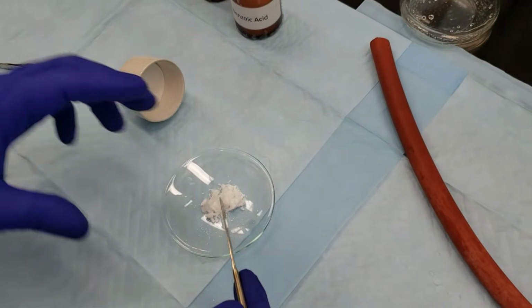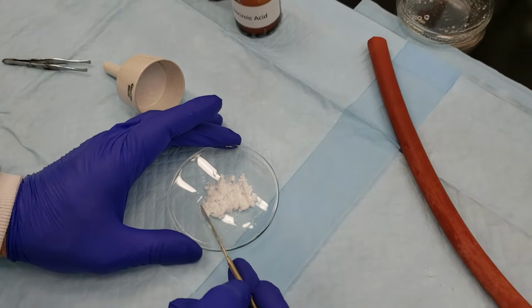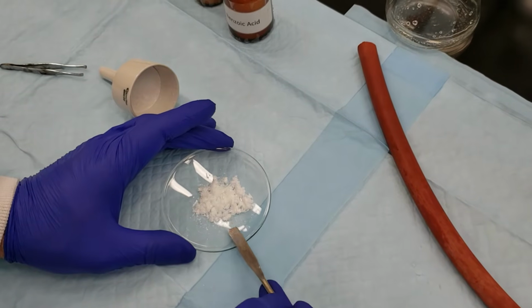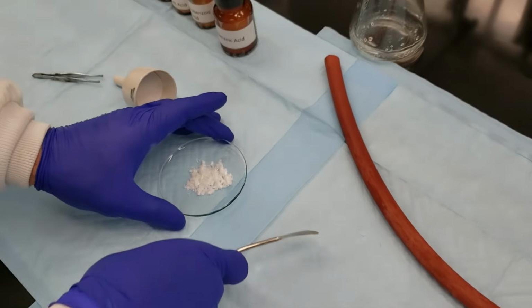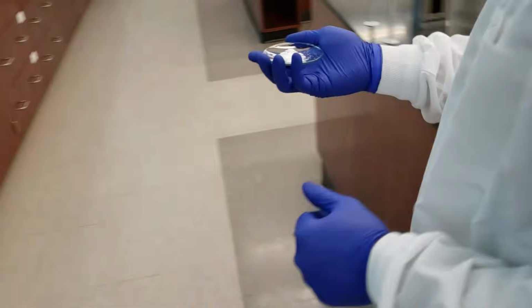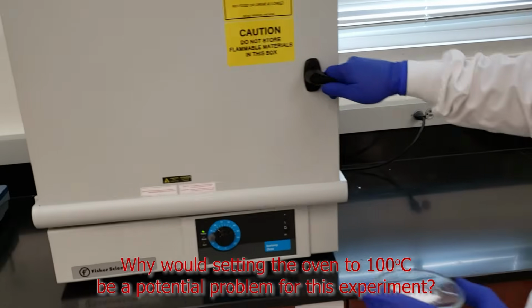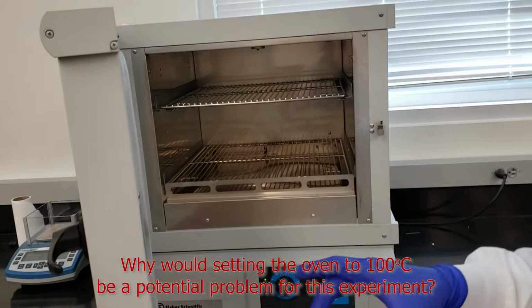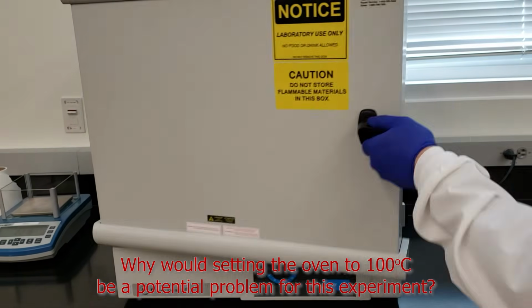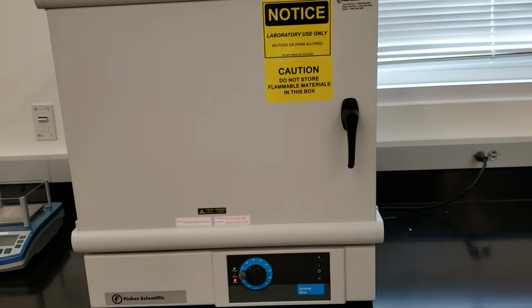Okay, so we'll take these crystals, we'll break them up as much as we can, try and separate them out, and we're going to move them over to our drying oven. Our drying oven is set to 100 degrees. We'll go ahead and set these in. And we'll evaporate off any remaining solvent over the next 5 to 10 minutes.